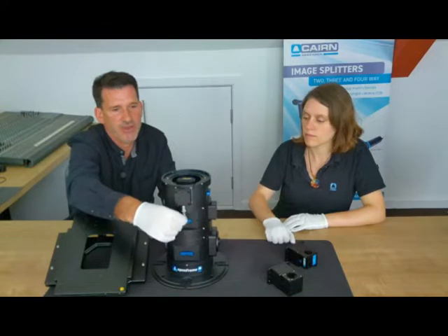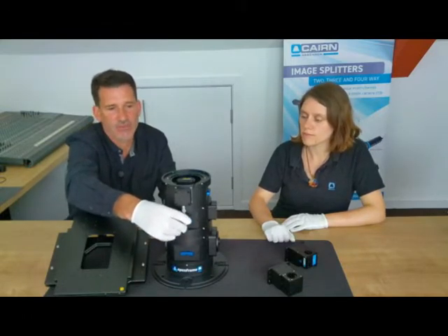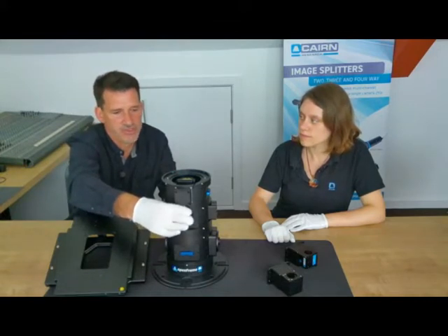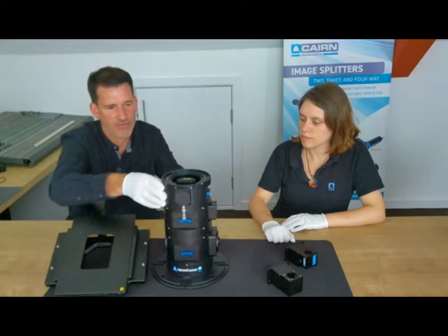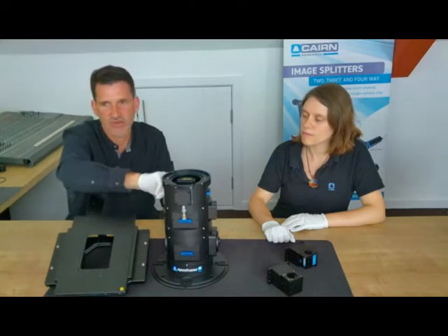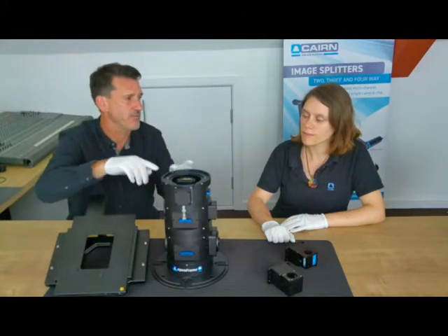We'll be showing the high-end, fully automated microscope at the meeting in our lecture slot. So this is the focus layer, the guts of the instrument. One nice thing about the focus layer is it also has the opportunity to bring in an epi source or an autofocus source within this layer.